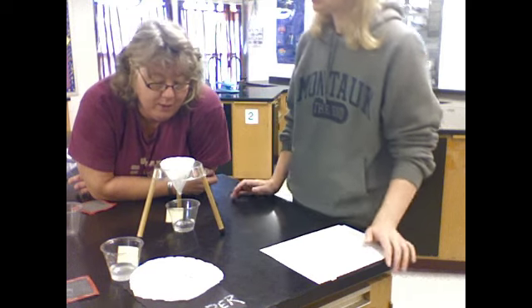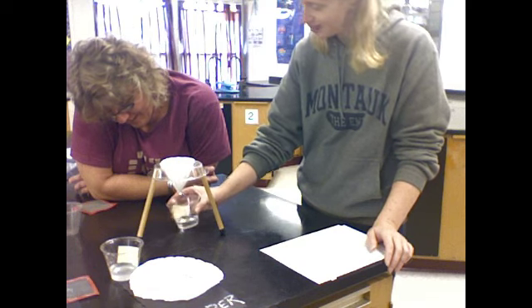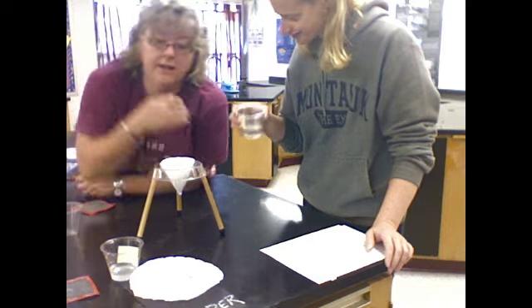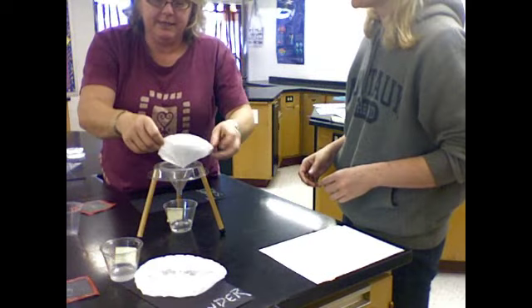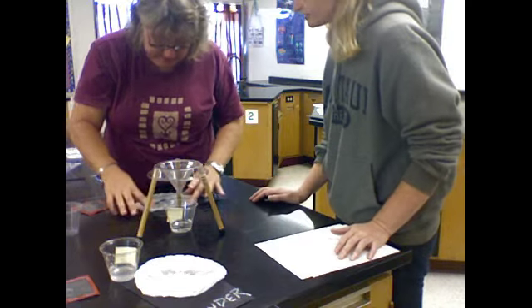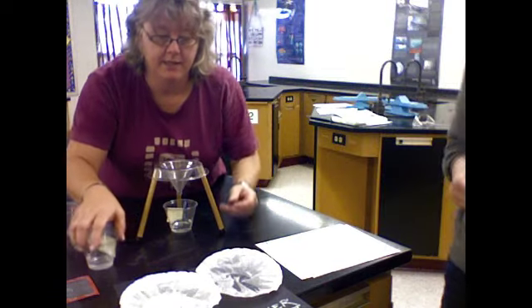All right, this is tougher because the water was clear to begin with. And it's still clear. I don't see anything in there, do you? No, but I didn't see anything in there before. Hmm. I'm gonna open up the filter and put it on this black paper and see if we can see anything. White crystals. All I'm seeing is water.